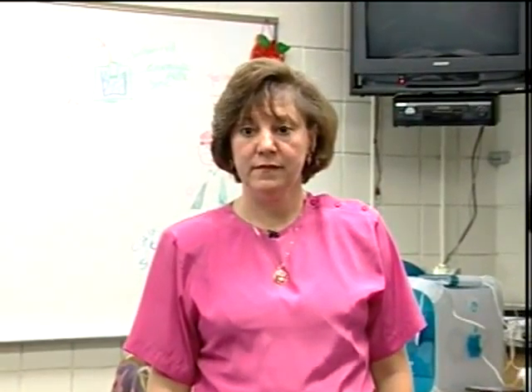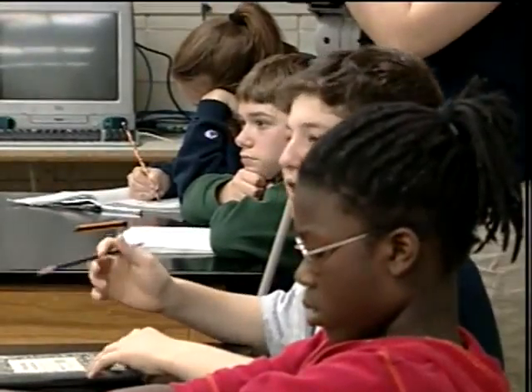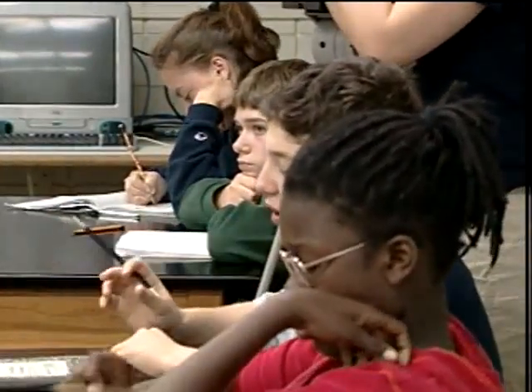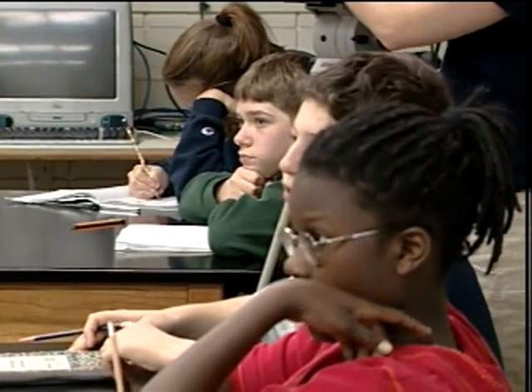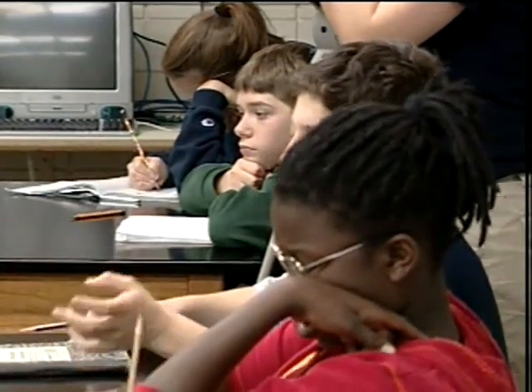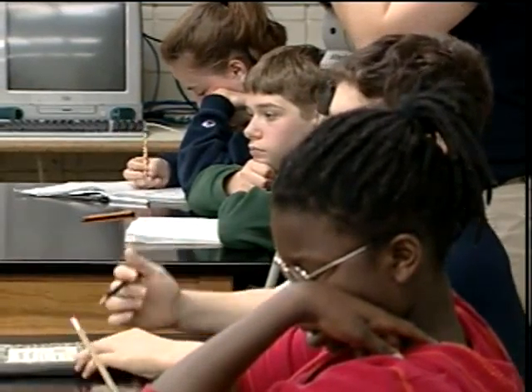So then you're going to get a very acidic substance, a very extreme substance, to set a range, as Bram said. So then you're going to take this and put the pH in the computer, and by doing that, the computer will find a formula that calculates from volts to the pH, and that way you'll have the known standard. Okay, then I have a known standard.